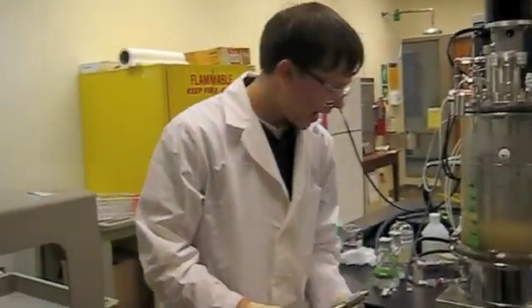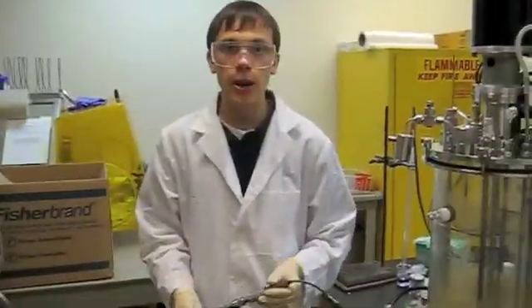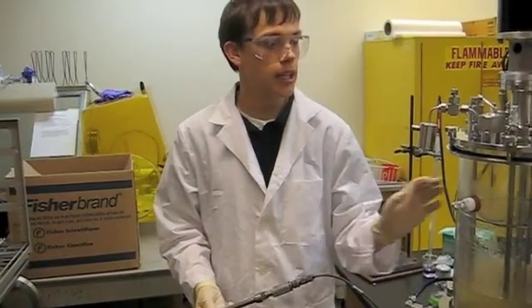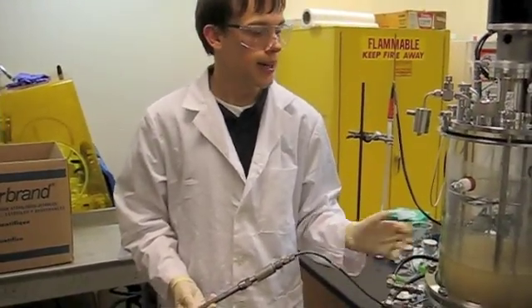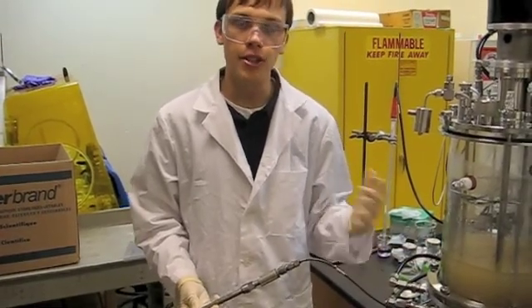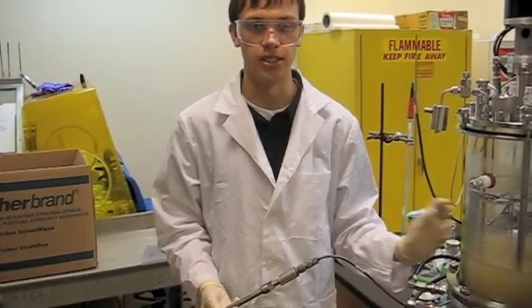Okay, so the next probe we're going to be hooking up is our DO probe. It hooks up to this connector. So now we have our DO probe hooked up, and we're going to insert it into our vessel. The DO probe measures dissolved oxygen in our vessel. And for this experiment, we're going to be using agitation to control DO in the system.